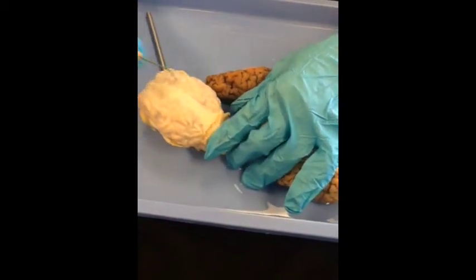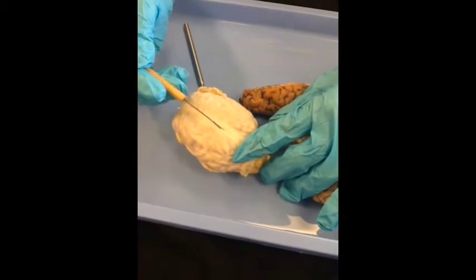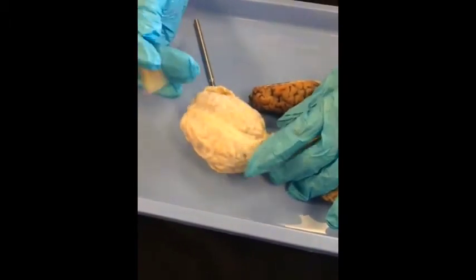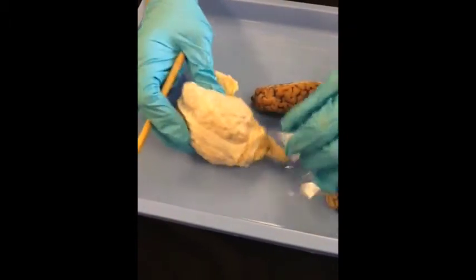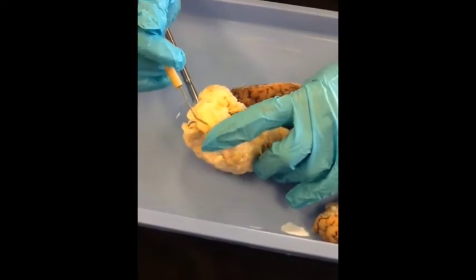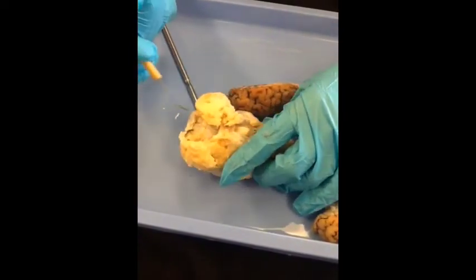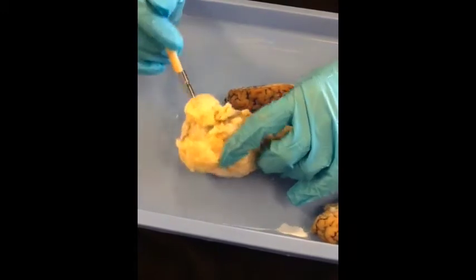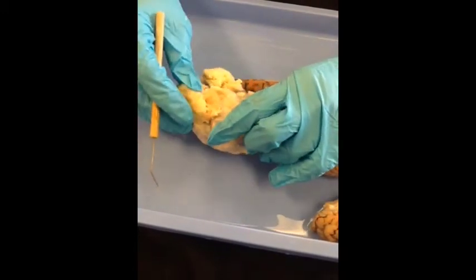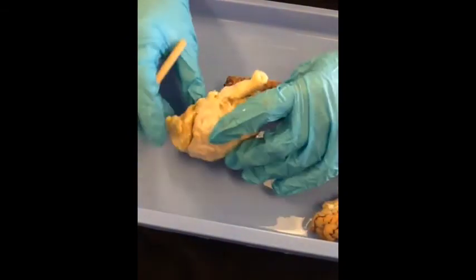This is your typical sheep brain. Underneath the dura is the longitudinal fissure. This is the dura mater. On some of the sheep brains, you do see the back parts of your eyeball. Some of that's still attached — you would want to cut it as close as you can to the base of the eyeball, so you're showing your optic nerve.